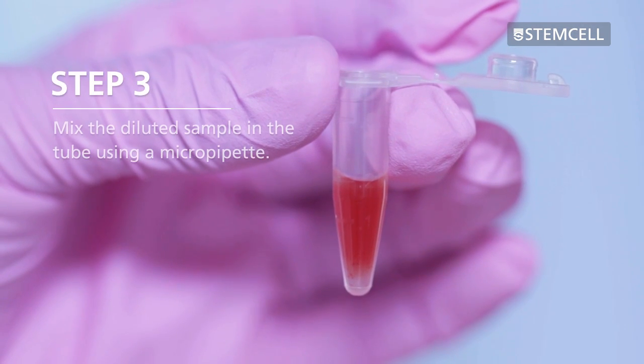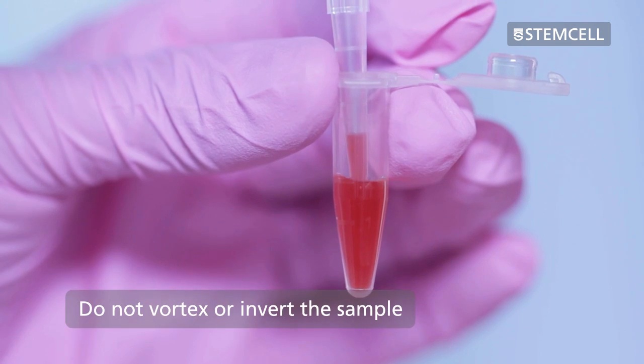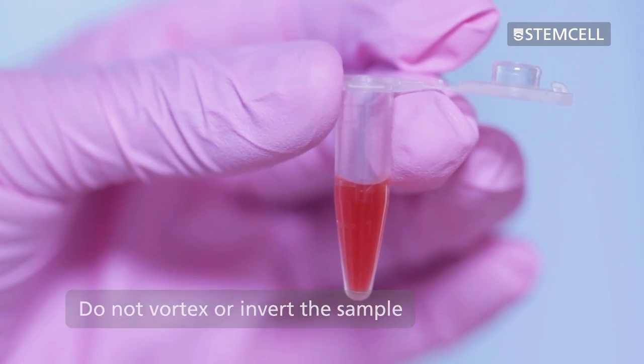Mix the diluted sample in the tube using a micropipette. Avoid creating bubbles and do not vortex or invert the sample.